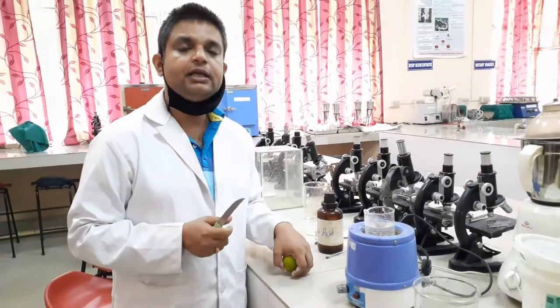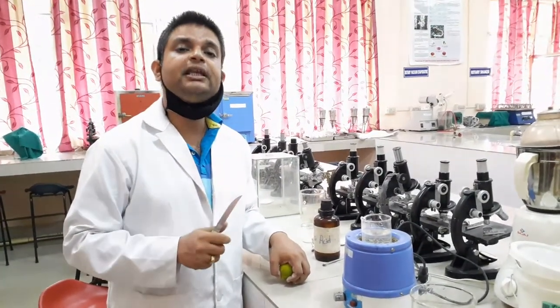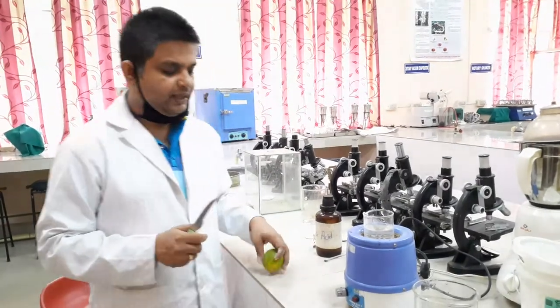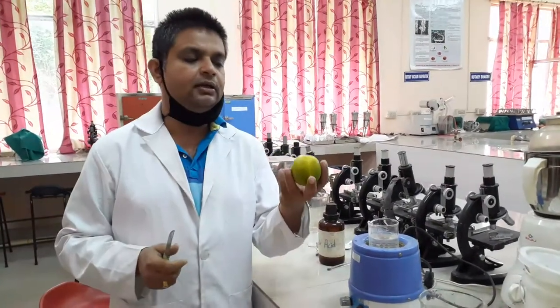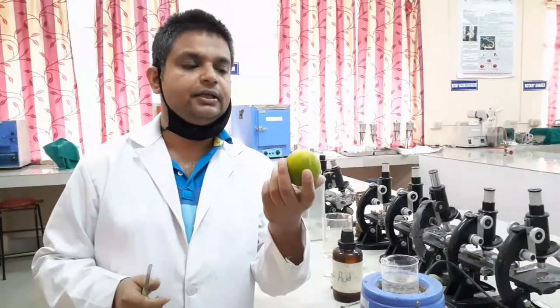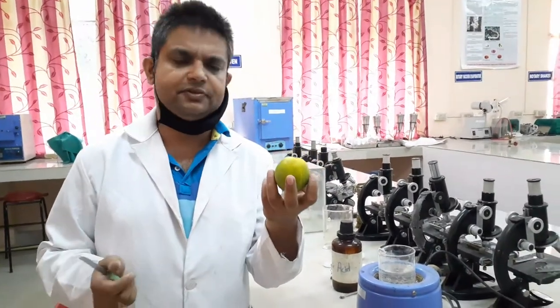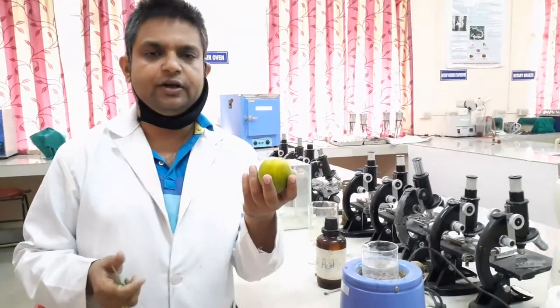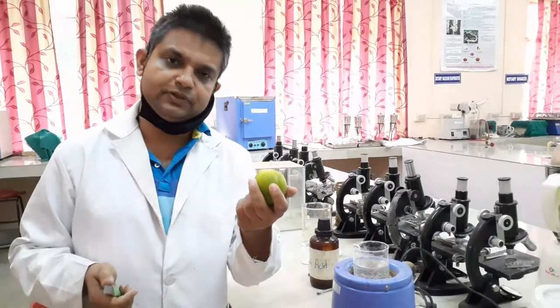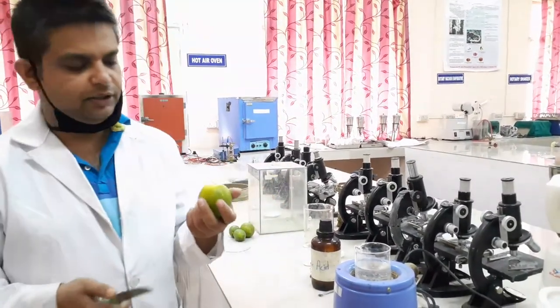Pectin is present in the middle lamella of the peel of citrus fruit. As you can see, we have taken the citrus fruit here. You can take any type of citrus fruit like lemon, orange, musambi, or anything. We have taken musambi here. You can take the orange peel also.